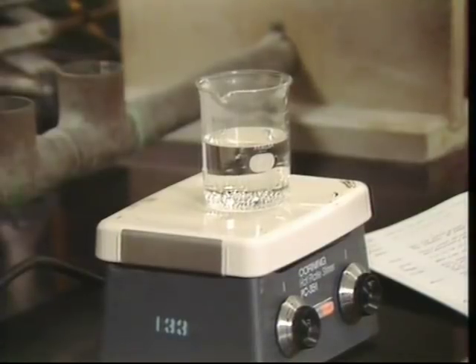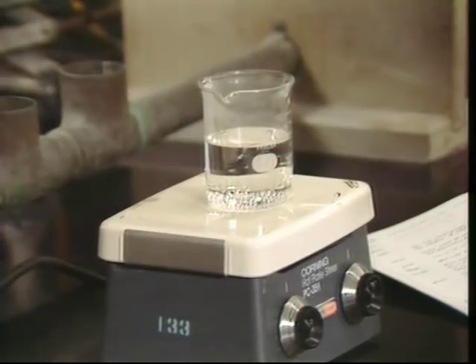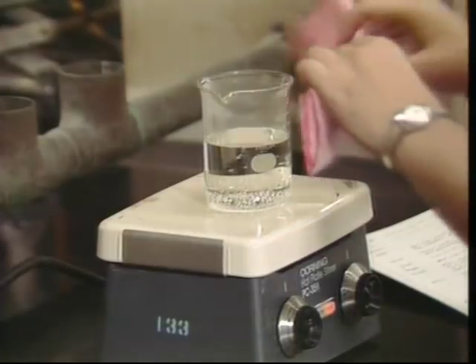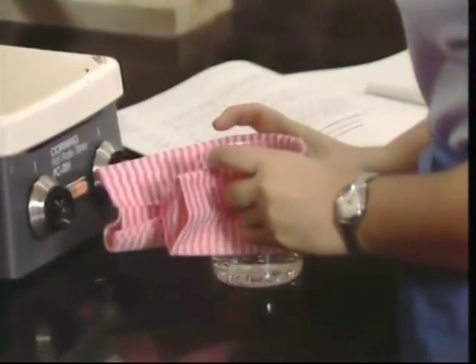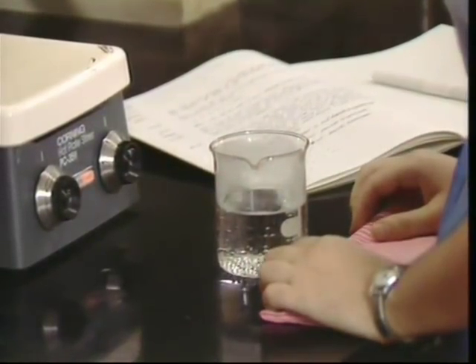Many of the experiments that you will do will require that you heat glass containers or possibly bend glass tubing in a flame. Now, unfortunately, there's no way to see whether glassware is hot. Therefore, if you're using a heat source around any glassware, always assume that the glass is hot. Handle it with tongs, pot holders, or other insulating materials.